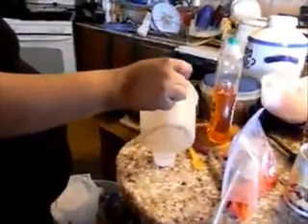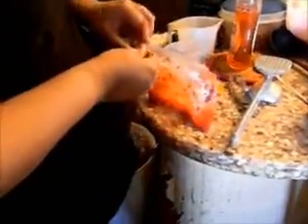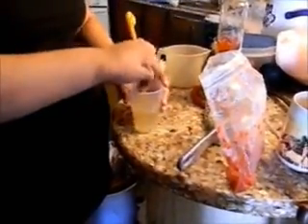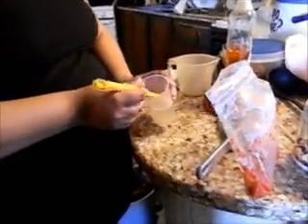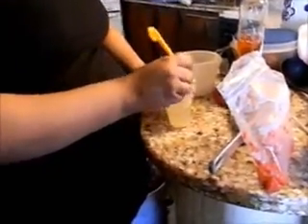Pour it in there. Now we're gonna pour that in— in this? Yep. Hold on, first you gotta mix it. So that would help. Stir it. Try not to make too many bubbles though. We wanna get it good and mixed together — as long as it can't tell the soap from the water, you should be alright. You're gonna need a little bit of bubbles regardless.